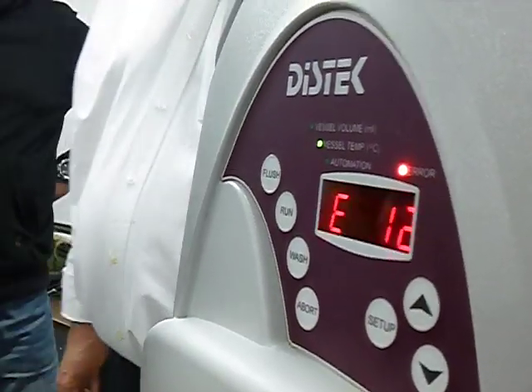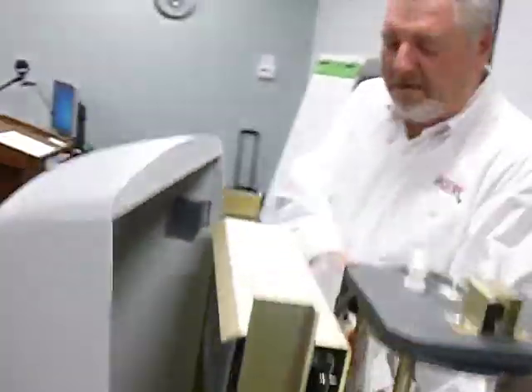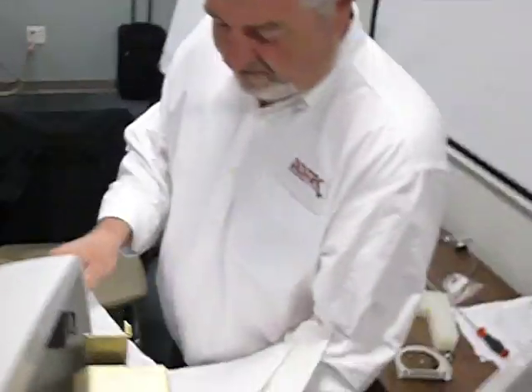And we get a fault. E12. All right. What's E12? I don't know. Error messages. Kind of like vitamins, the B12. Let me look them up if I forget. I always carry around a manual, some old fashioned.